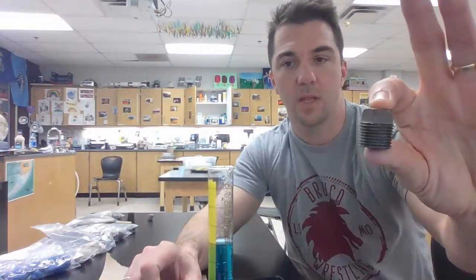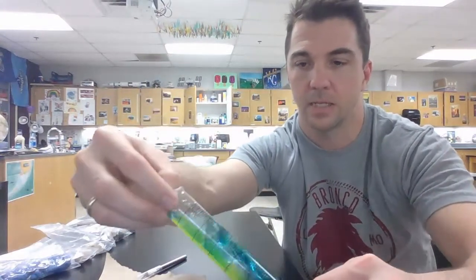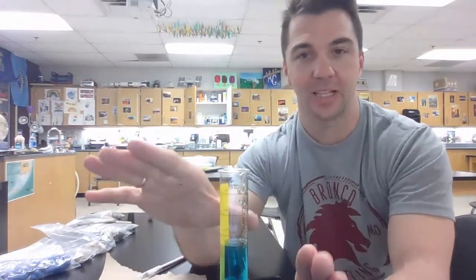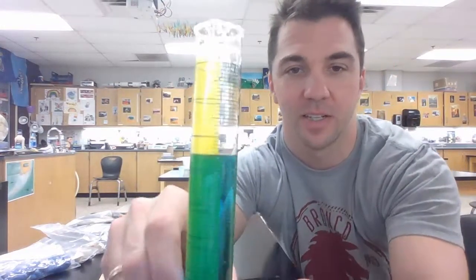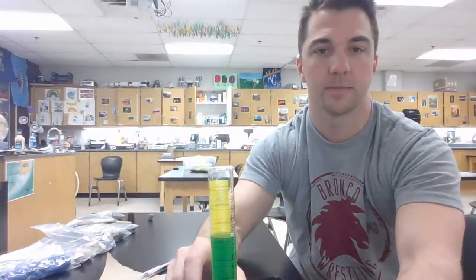Next up, iron. Very heavy, so I definitely want to ease this in. Oh, I lost a little bit. We're going to say that drop or two is negligible, so hopefully that won't matter that much. Kind of got away from me. As always, we start at 70, and there's where we're at. There you go. That was for the iron.